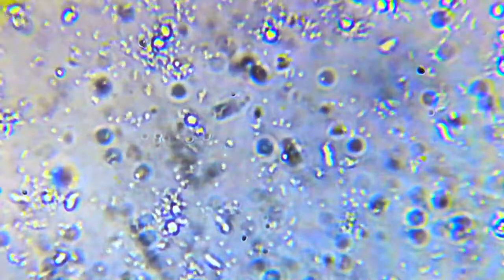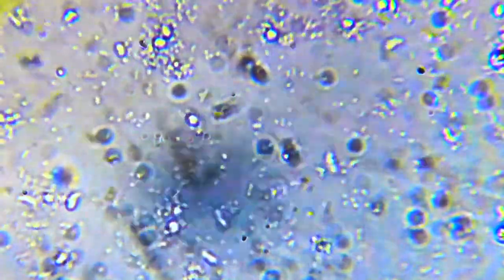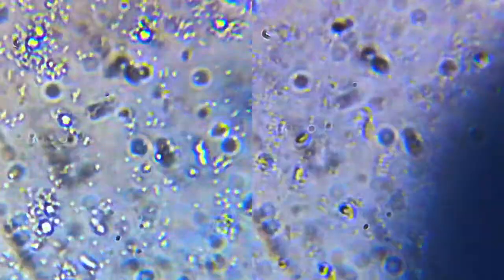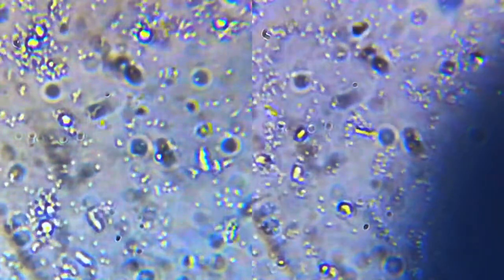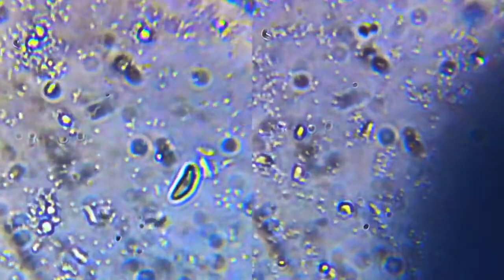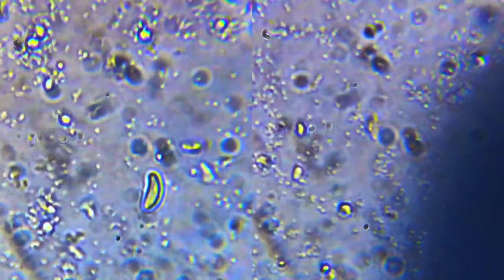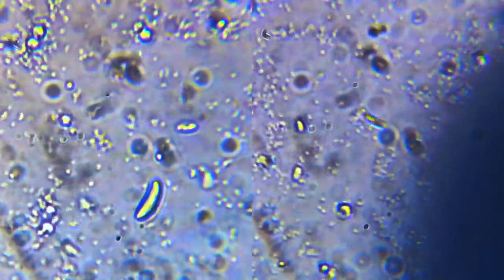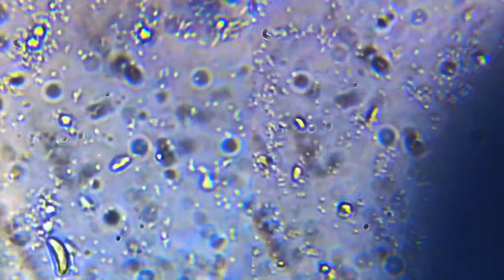Here is the footage before I poured the alcohol. Here is a comparison: the left is before I poured the alcohol, and the right is after the alcohol. Notice how active they were before I poured the alcohol.